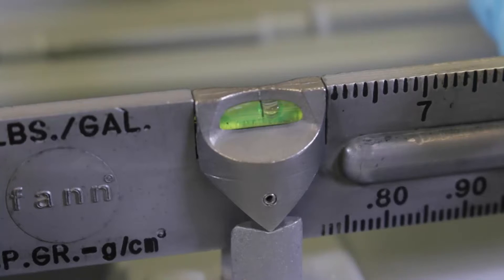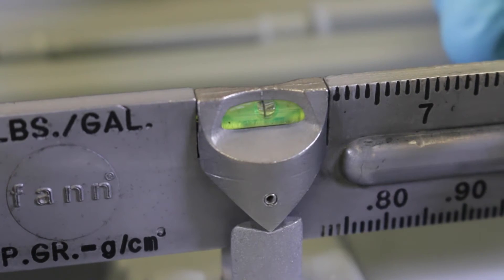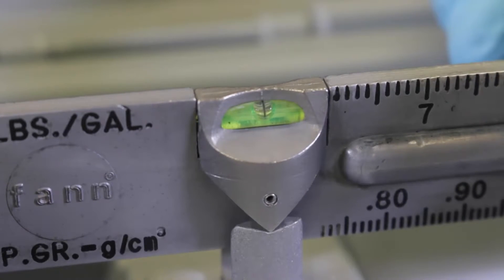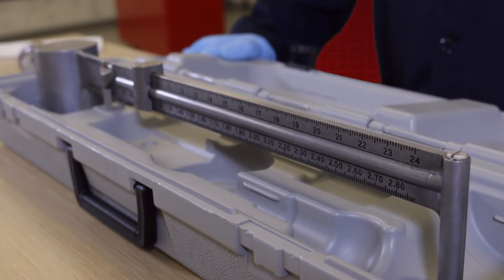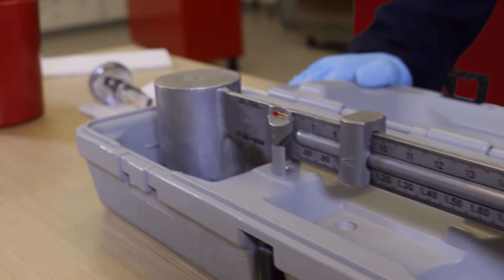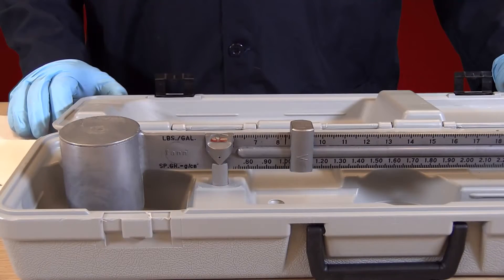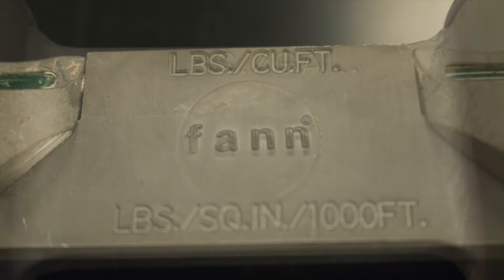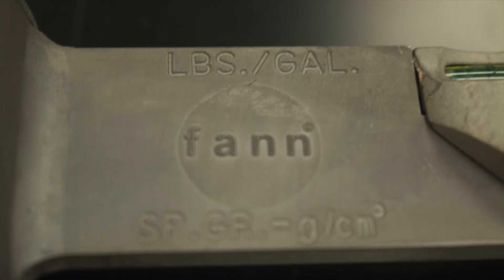There is a knife edge attached to the arm near the balance cup, and a bubble level built into the knife edge to indicate level. A fulcrum is mounted on a base stand or in the plastic carrying case. The four calibrated scales on the mud balance allow drilling fluid density to be read directly in units of pounds per gallon, pounds per cubic foot, grams per cubic centimeter, or as a drilling fluid pressure gradient in psi per 1,000 feet depth.